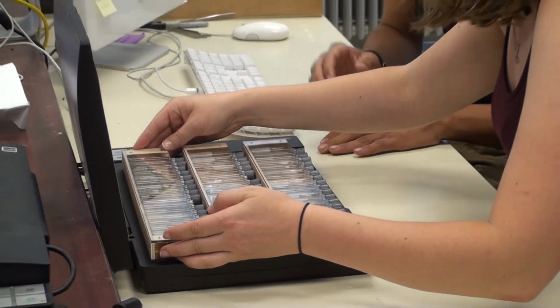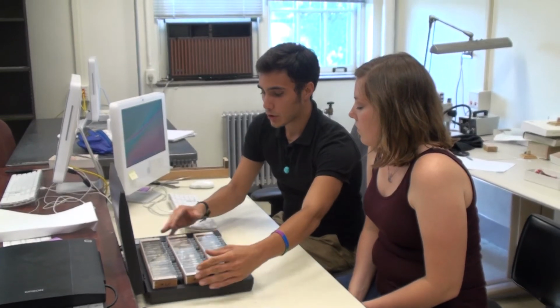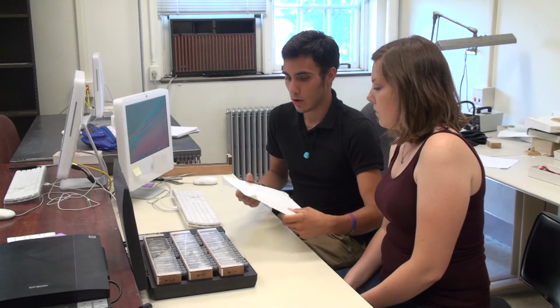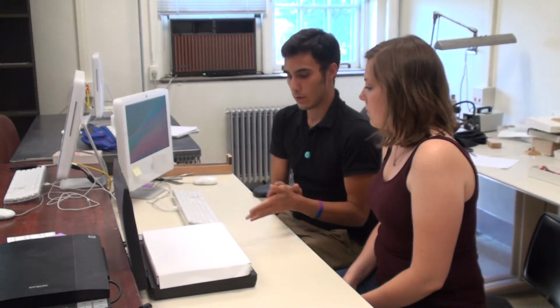Now, I should remind you that the primary goal of this imaging technique is to capture all this label data and these images rapidly. It is not to produce high-quality images of the specimens themselves. A lot of times these are very small insects that you're just not going to get the best image of them. But in any case, you can sometimes get an idea of how many are in there. With larger insects like stoneflies and mayflies, you will be able to get a pretty good image. But the goal of this is just to have rapid label data capture.